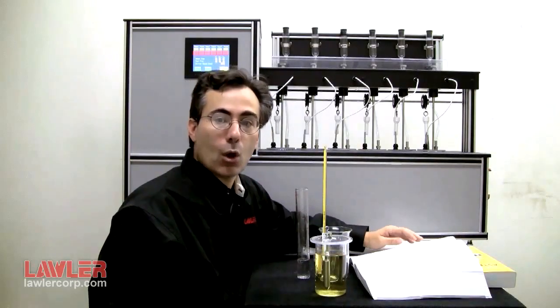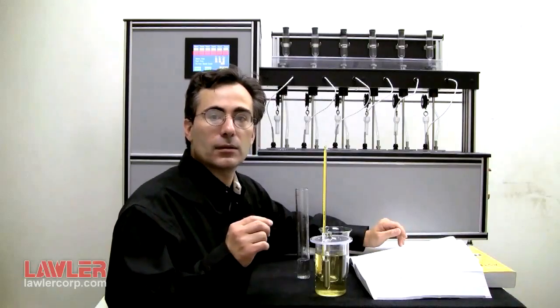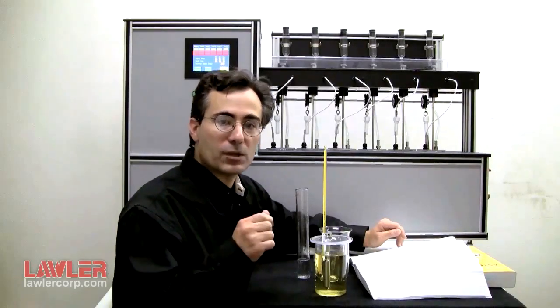30 minutes after lowering the steel rod, another moment of involvement. 30 milliliters of water must be added.